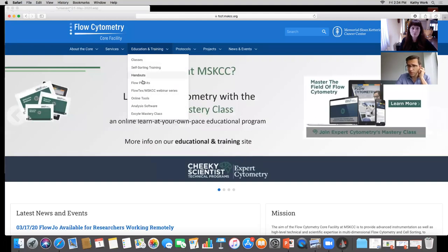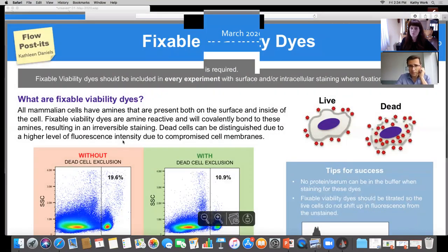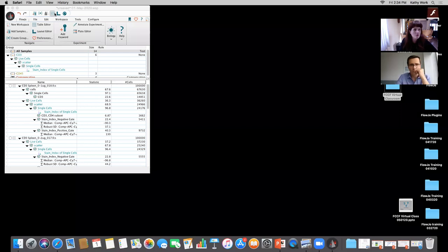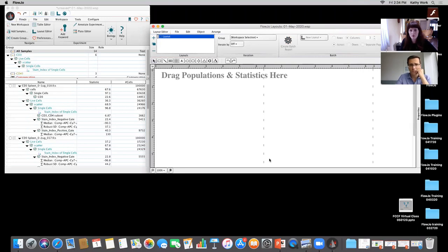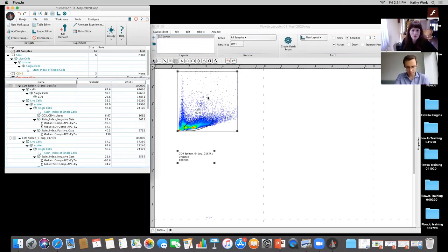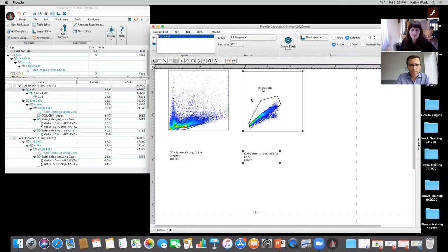I actually have a question for you that you can show there in FlowJo. Somebody's asking that in the latest version of FlowJo, they're unable to put the FACS plot layouts in the layout editor into a grid. Can you explain how to do that? You want it in a grid. Yeah, in the layout. I don't think I've actually ever done that before. Let's try and find out. I've done it before, not in the latest. So you want the plots themselves to have the grids in the plot? Is that the question? Or like what specifically?